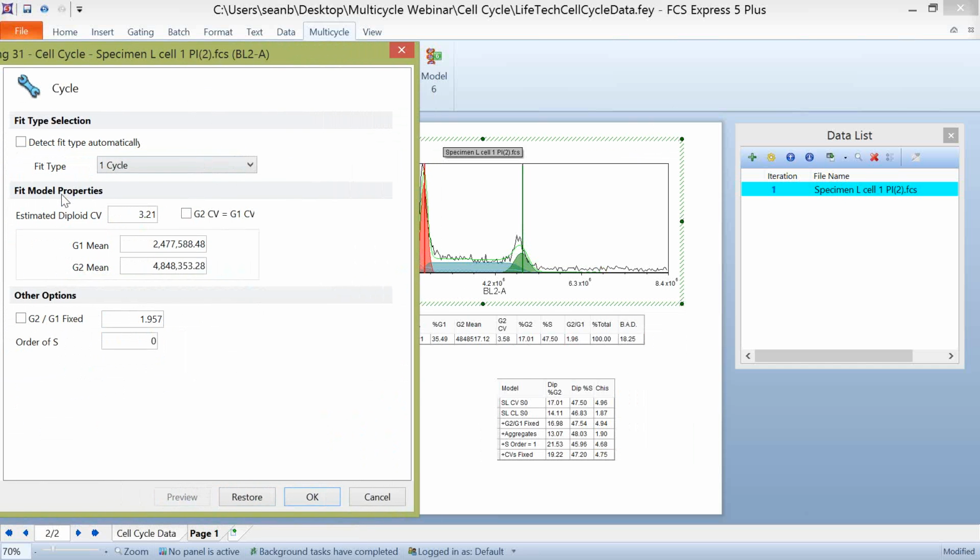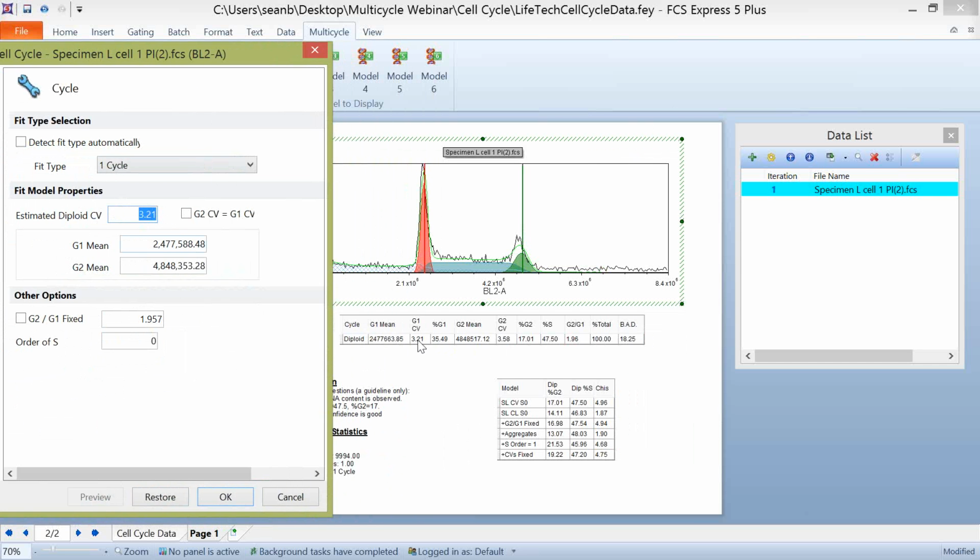Now, in the fit model properties, another property that you can change is the estimated diploid CV value here. You can see in our multi-cycle statistics we have our G1 CV values, or the spread of G1, and our G2 CV values, or the spread of the G2. If you wanted to constrain or expand this value, maybe because you've acquired data that has a very narrow peak, or a very broad peak, you can simply type in a new value here to see how that will affect your model. If you type in a value that's too high, like a CV value of 100, of course that's not going to work, because modeling the data using that value is not going to be correct.